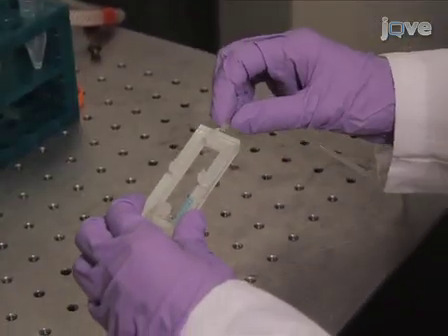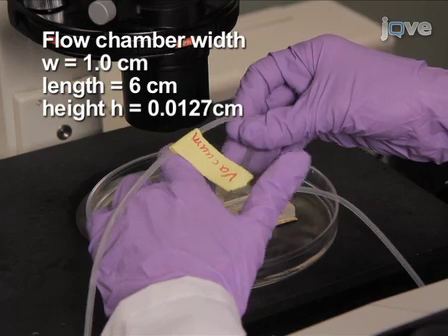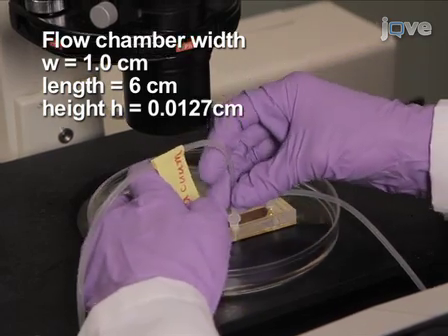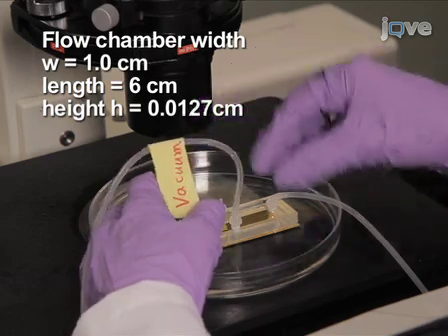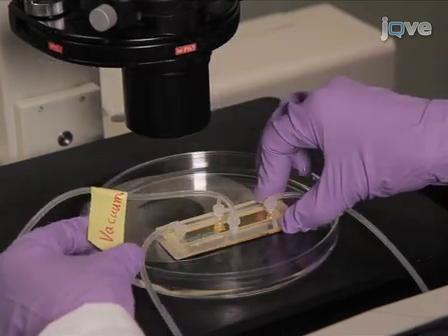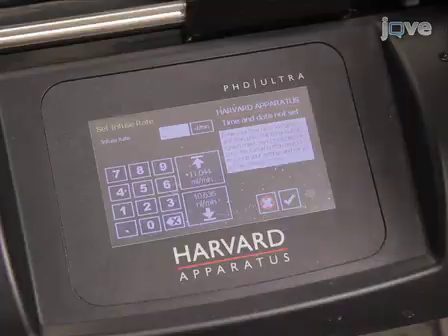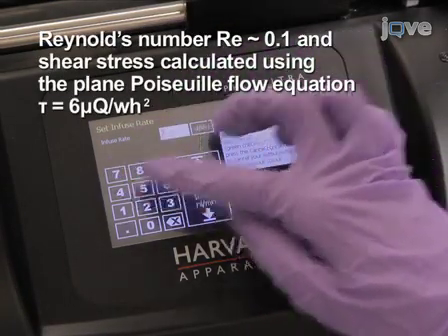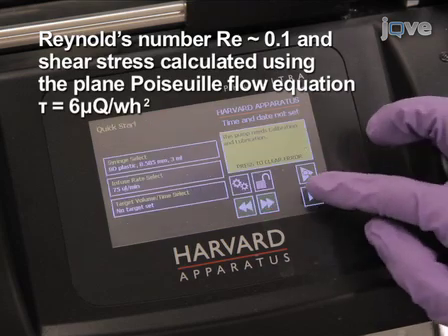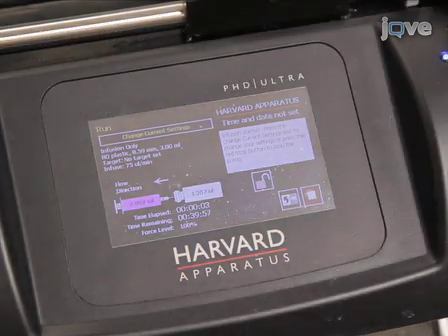Assemble the flow chamber, and then flow a suspension of 10 to the 5th cells per milliliter HL60 cells over the patterned surfaces in a rectangular flow chamber with inclination angles of the receptor pattern of 10 degrees at room temperature of 24.5 degrees Celsius. Adjust the syringe pump to generate a flow rate of 75 microliters per minute with corresponding laminar shear stress of 0.5 dynes per centimeter squared.